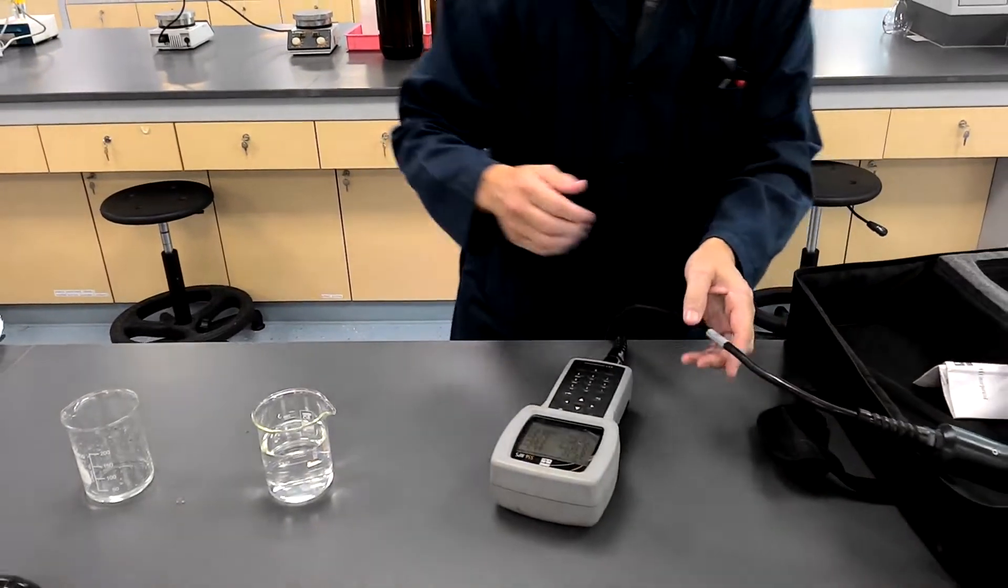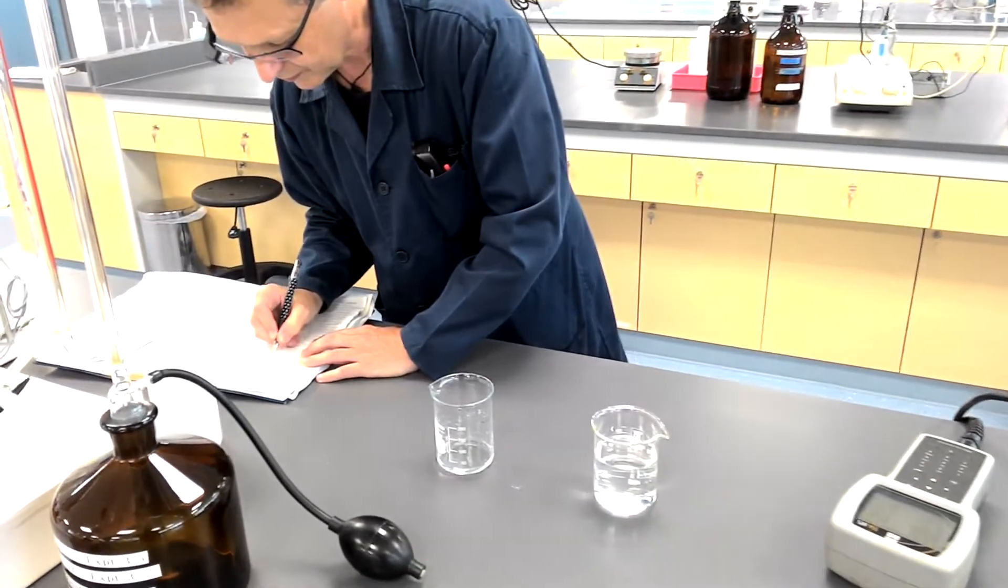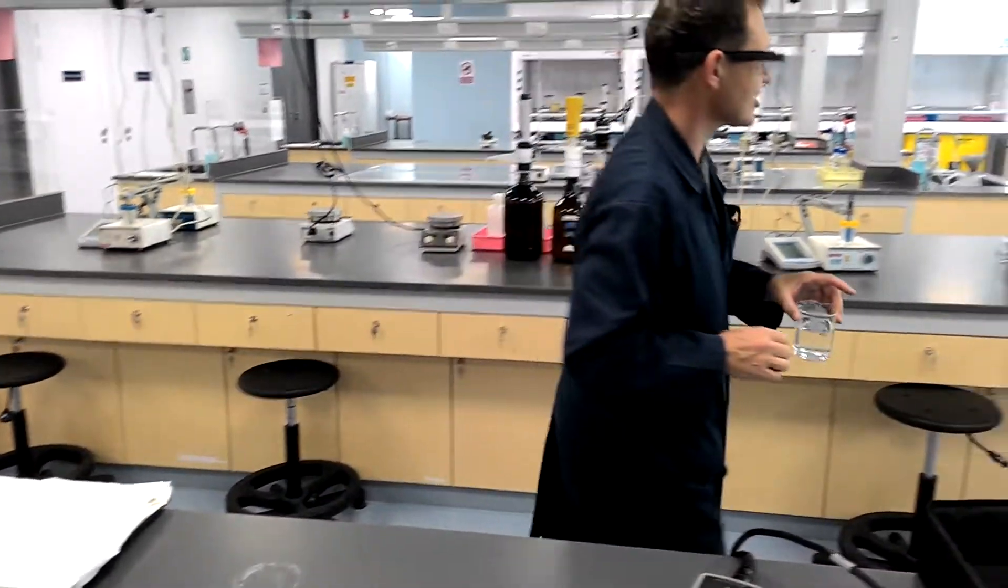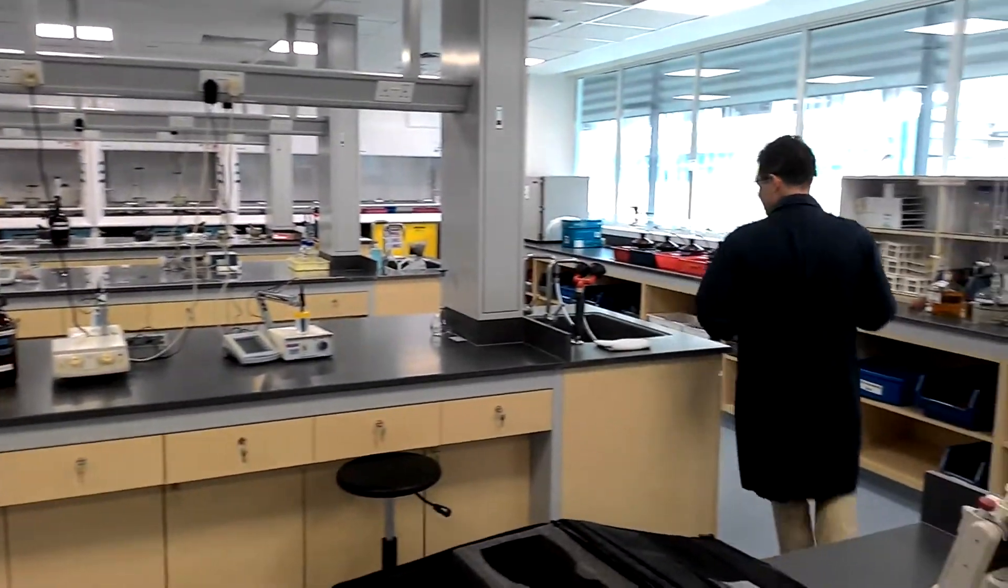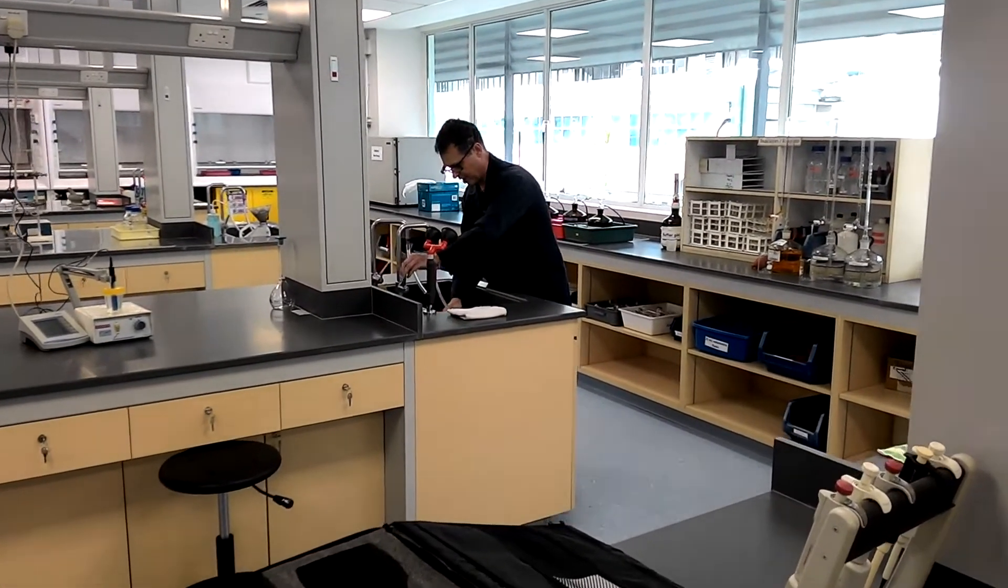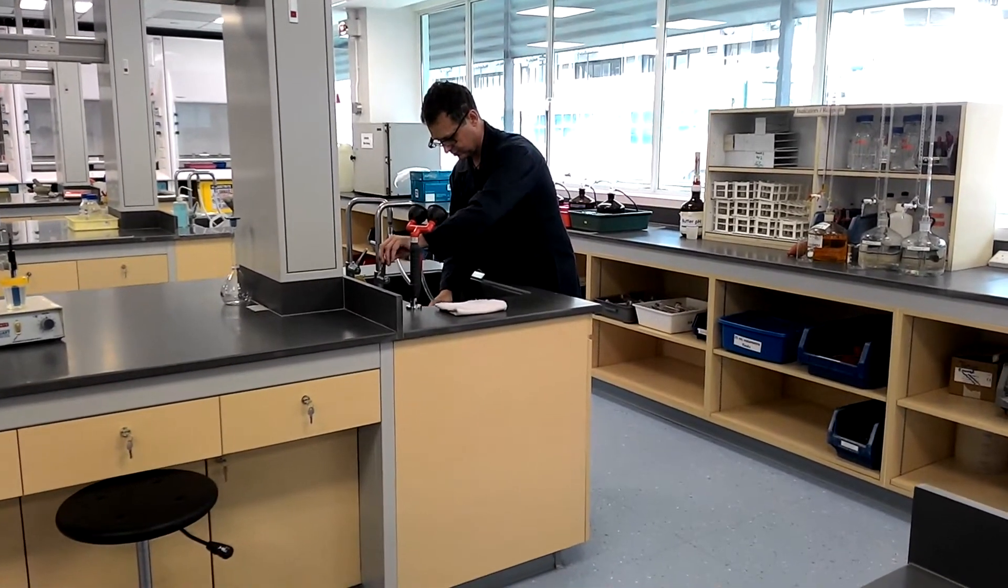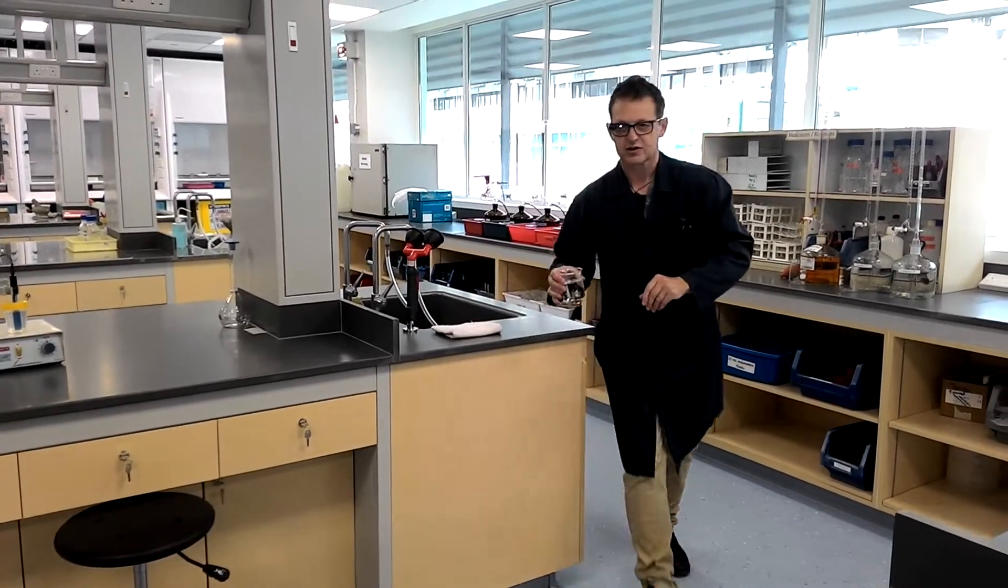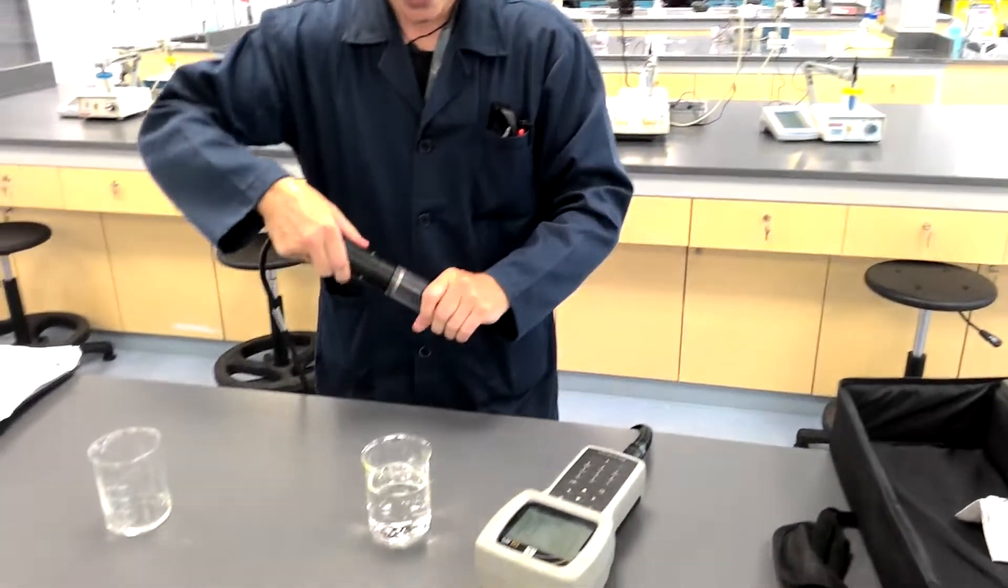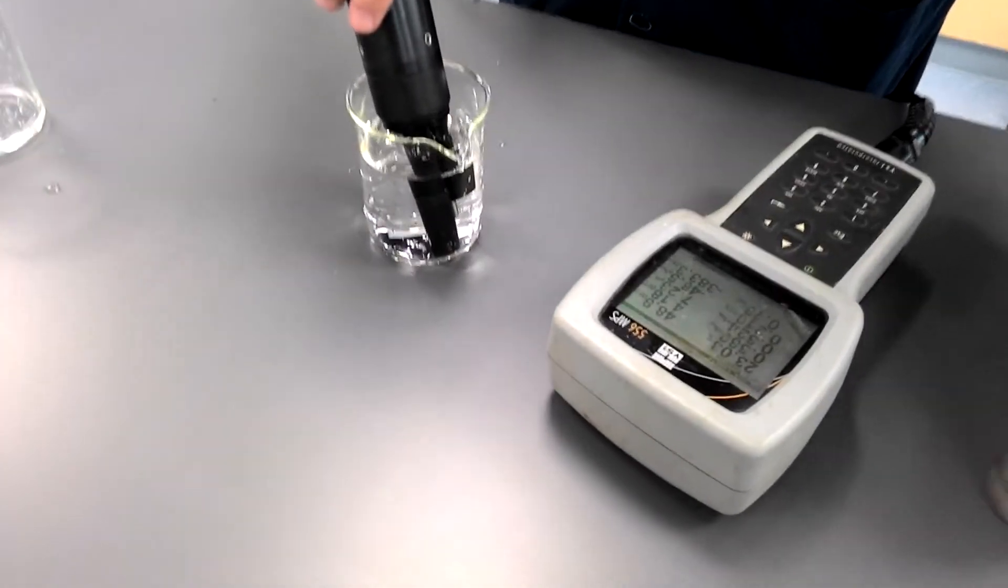I'm going to record, as I only have one set of hands, the dissolved oxygen. And that's all I'm actually interested in. I'm not really interested in the pH. And now I'm going to do an experiment. I'm going to increase the amount of dissolved oxygen by basically mixing the water up a little more. And what we should find now when we do this measurement is the value should be above, I hope, 0.14.